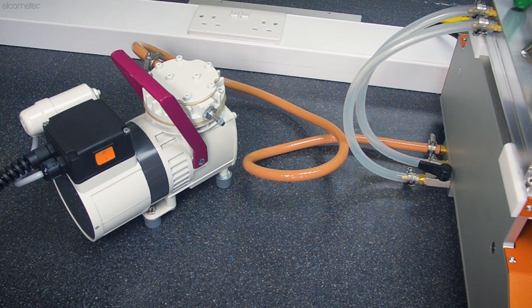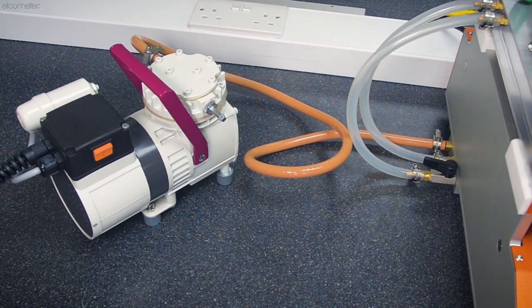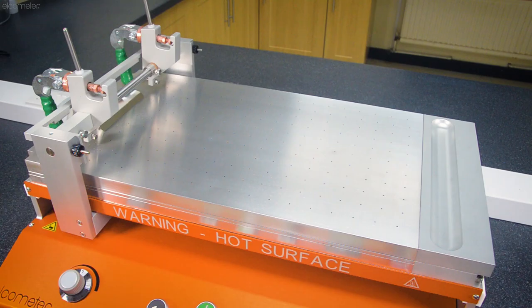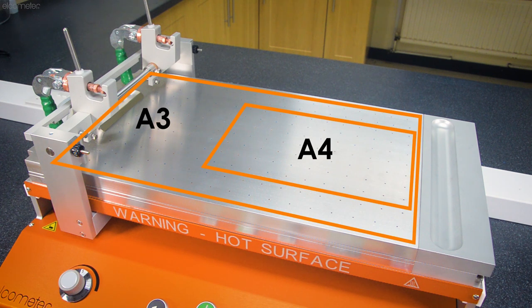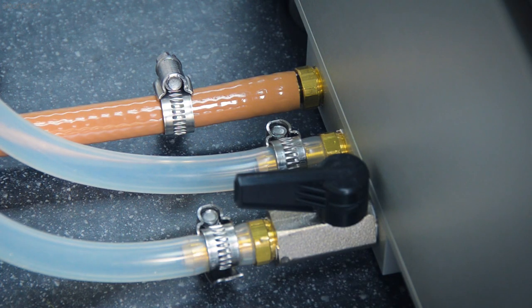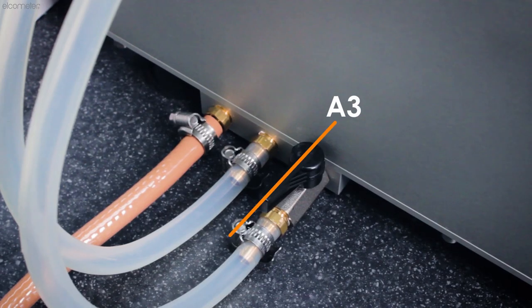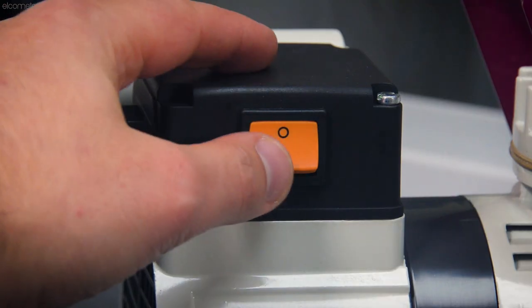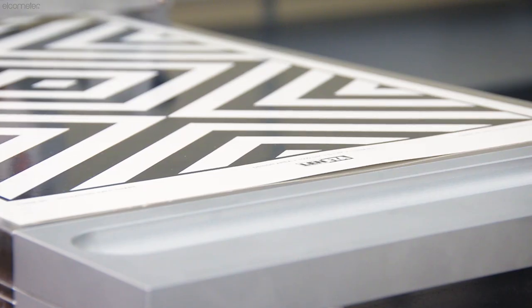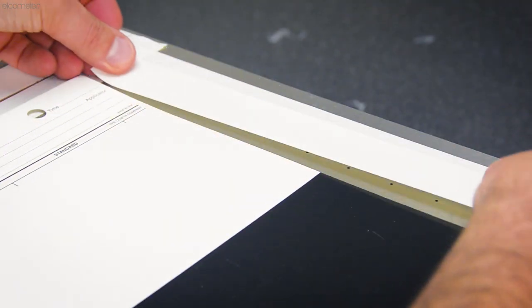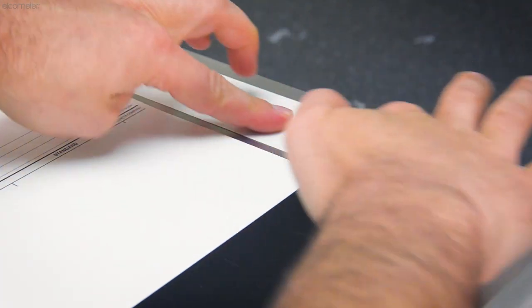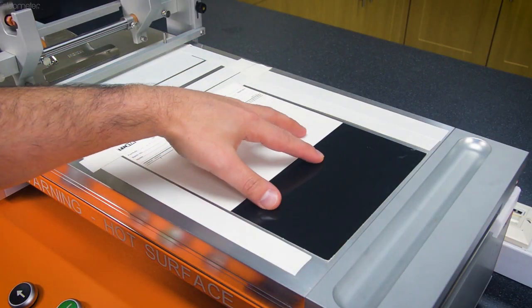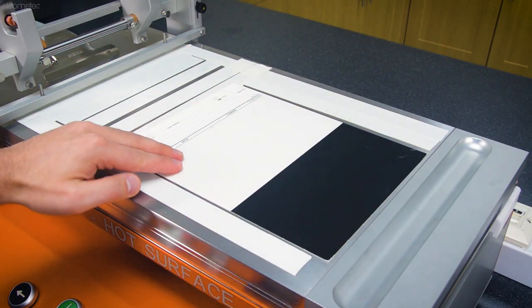On our vacuum tables, which are powered by a separate vacuum pump to reduce vibrations that could affect film quality, it's slightly different. When using a perforated vacuum table, position your substrate as shown, attach the vacuum pump using the hose to the connection on the left side of the machine, select the substrate size on the vacuum control—on for A3 substrates and off for A4 substrates—then switch on the vacuum pump. The substrate will be drawn onto the table and held firmly. Any areas not covered by the specimen should be covered using Scotch tape or similar removable thin tape to prevent product from getting into the vacuum table and to ensure maximum suction is applied to your substrate. If you don't have suitable tape available, strips of paper can also be used to cover the holes.